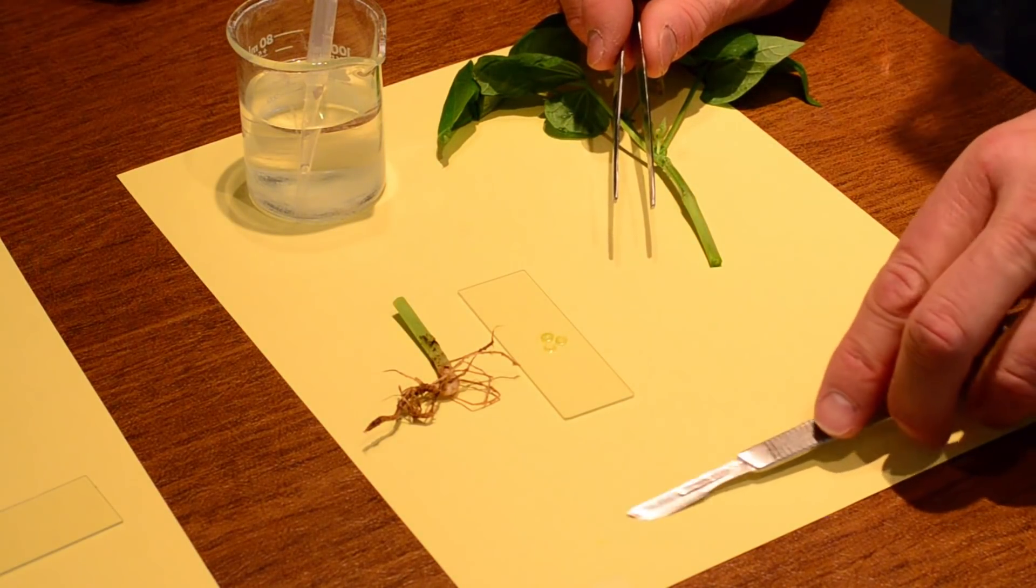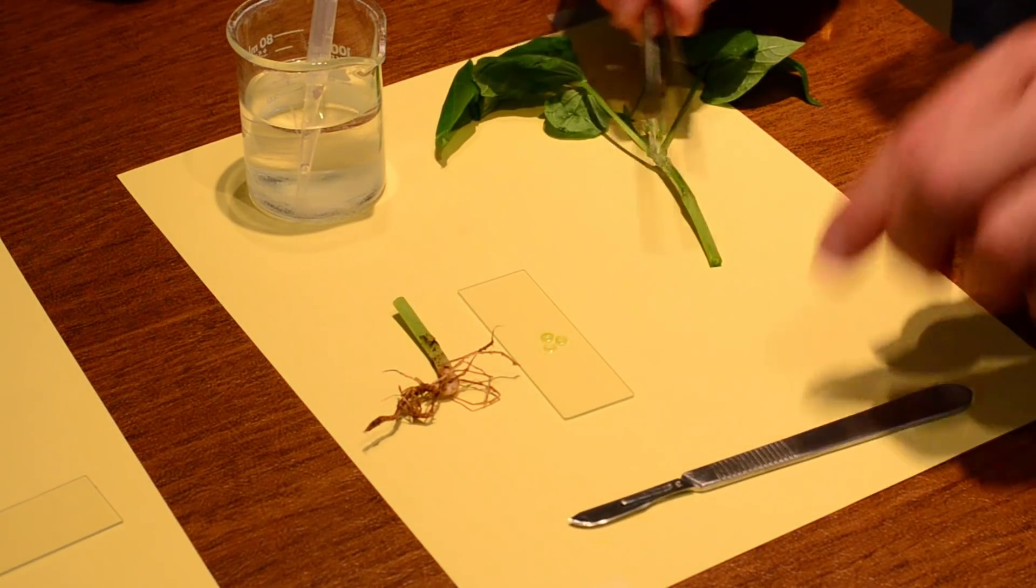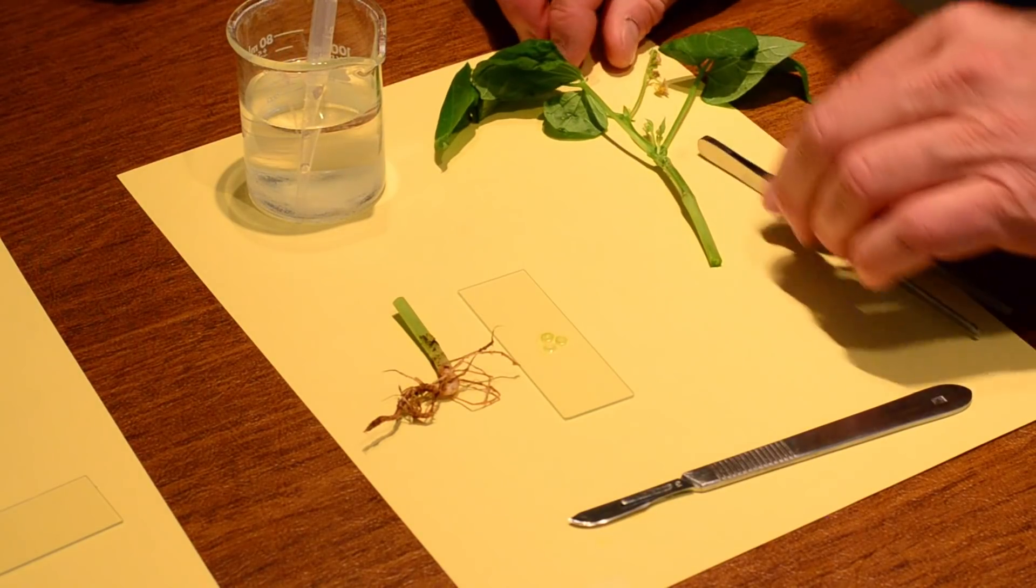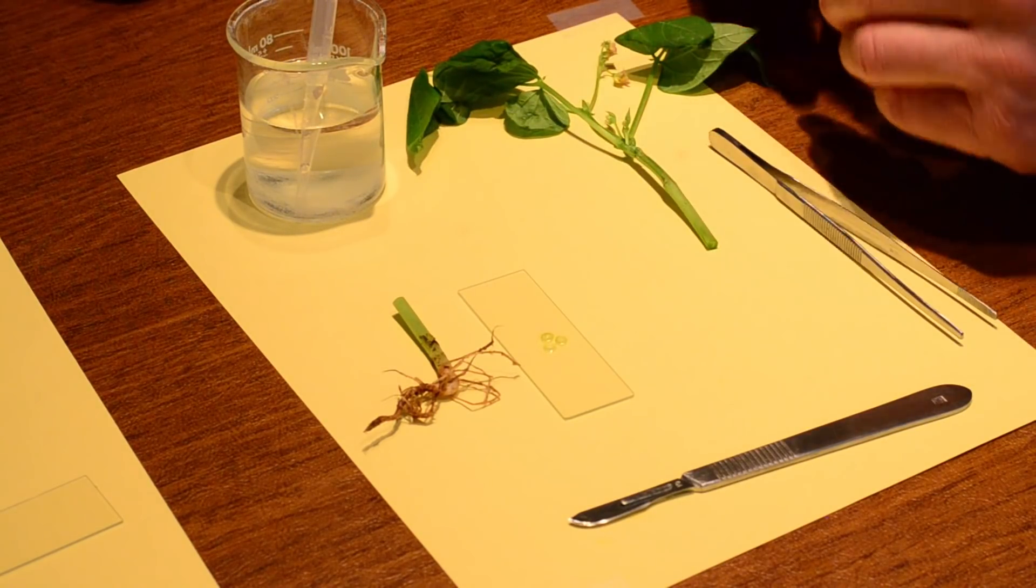And when I put this under the scope, y'all, and notice how I'm using very slow movements. I'm not moving fast at all. Slow, deliberate movements.